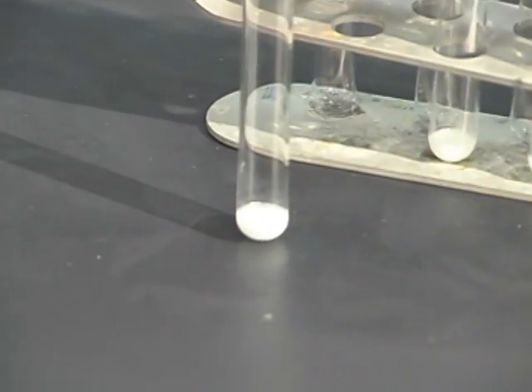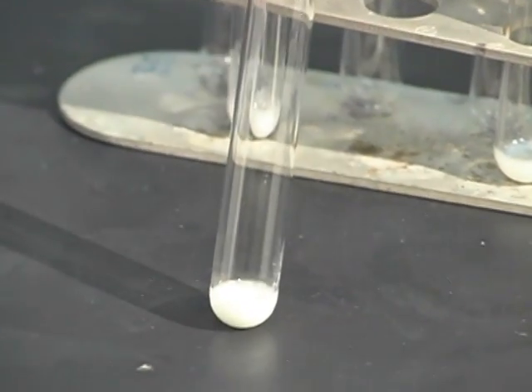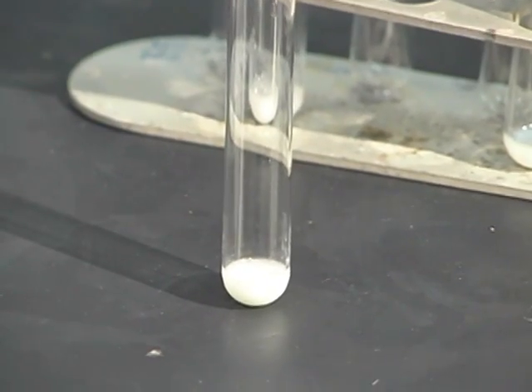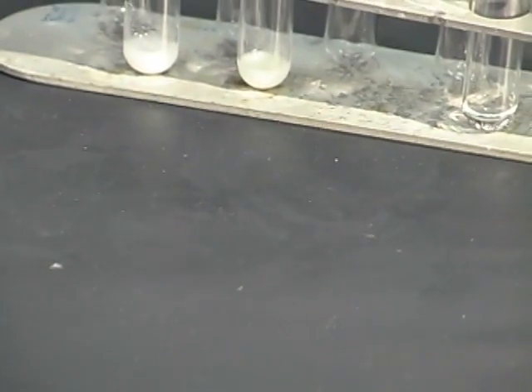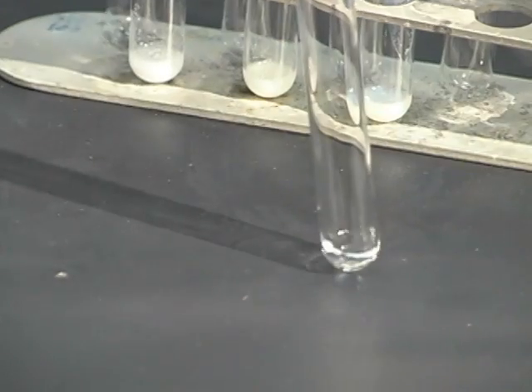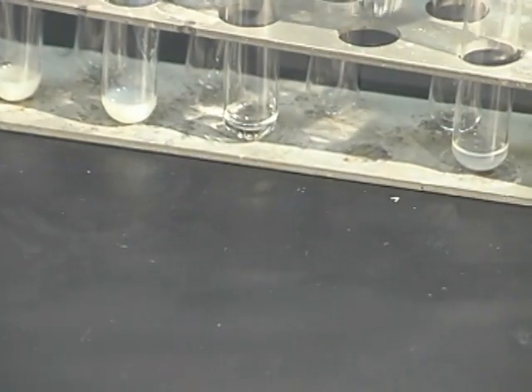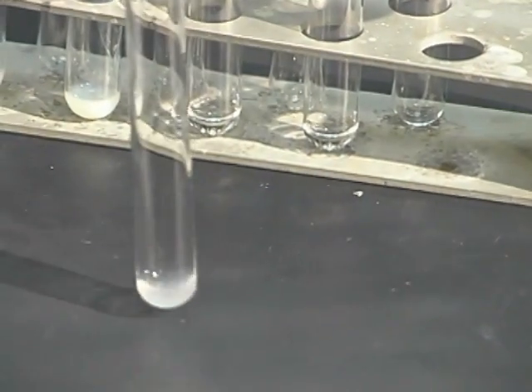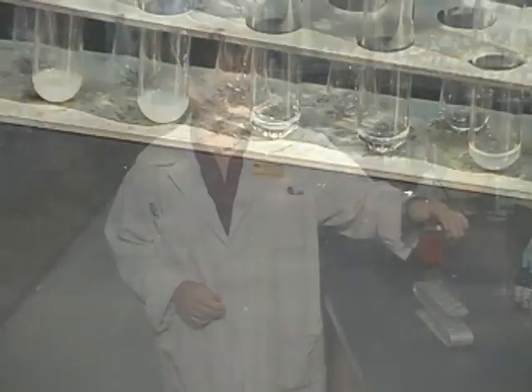You can see very clearly here — the chlorine has a very clean white precipitate, the bromine is a little bit off-white, again a precipitate, and iodine also has a precipitate, almost a yellow colour. Whereas the sulfate is still clear, as is the nitrate, and the acetate looks a little bit cloudy but there is no precipitate. So this is a screening test for halides: if you get a precipitate you're dealing with a halide, if you don't you're dealing with one of the other ions.